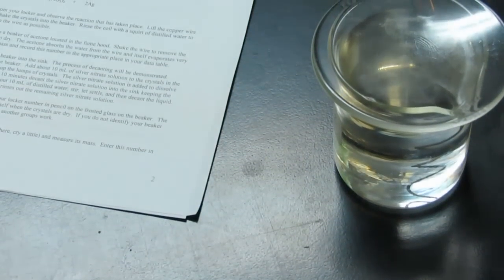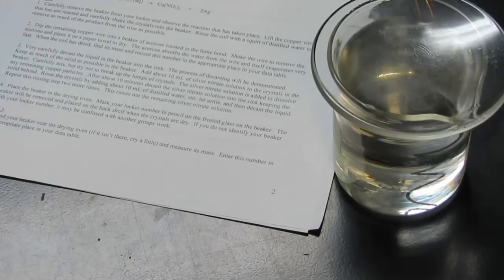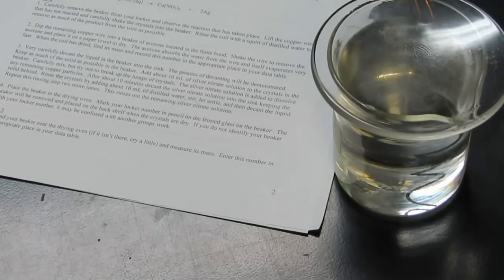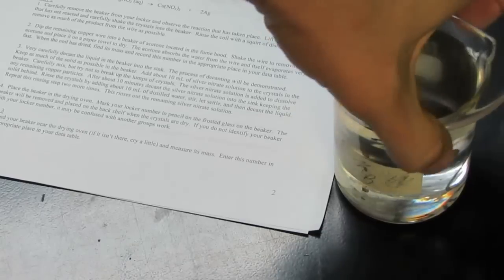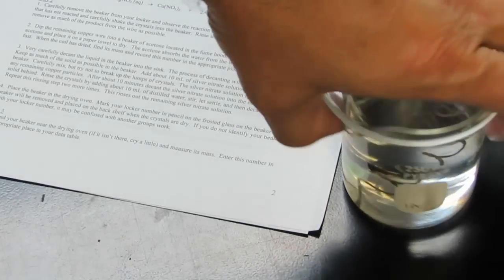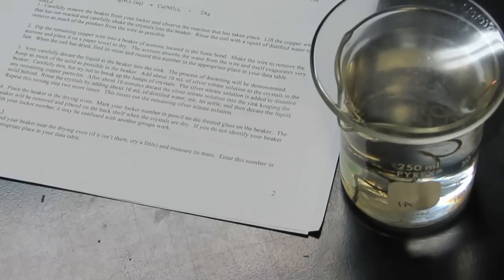Now we're going to leave this in our lab locker for a couple of days. We're going to let it sit overnight. It'll be one block period for you folks. And when we come back, we're going to marvel at the reaction that occurred. So this is the end of day one. Once again, you'll put this in your lab locker. Make sure you follow my instructions so you put it in the proper locker.